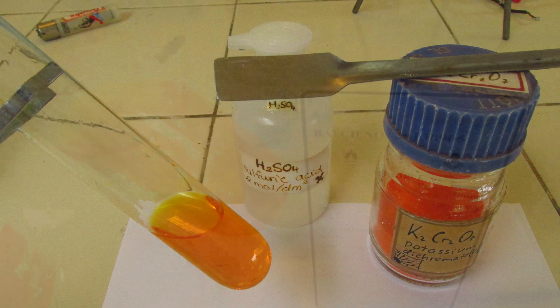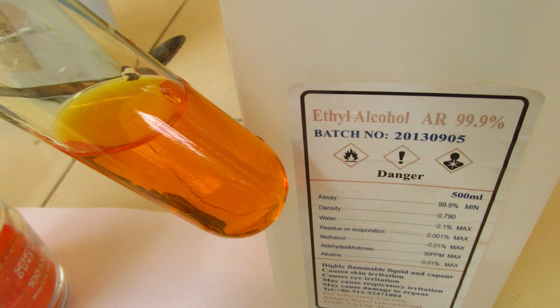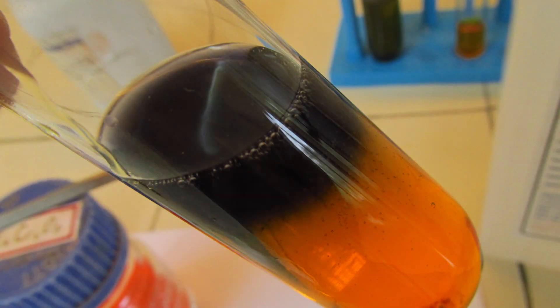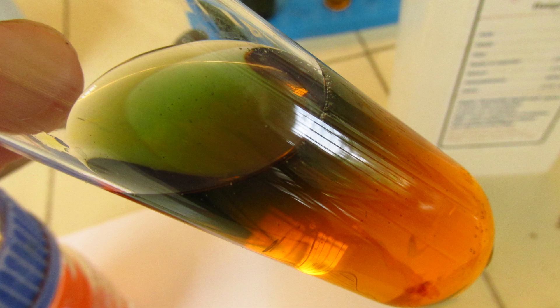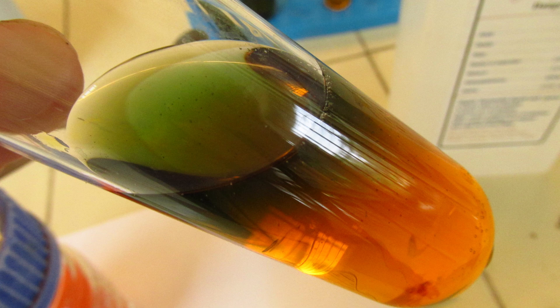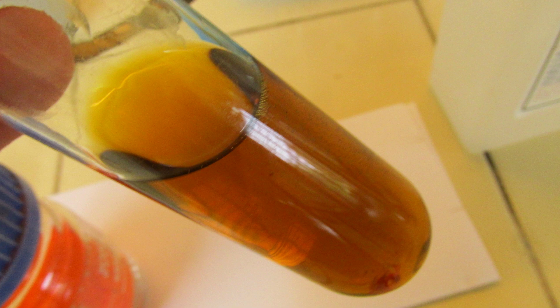Let's try ethanol. So I'm adding ethanol here, and you see there is some indistinct dark something on the top. It's where my ethanol went, maybe half cubic centimeter or so. You see it changes slightly into green, and if I shake it, it's just some indistinct dirtish color.